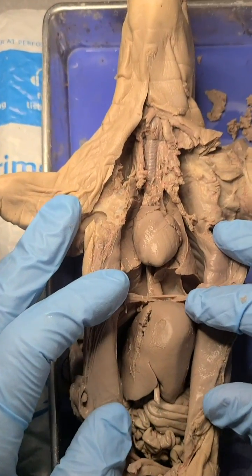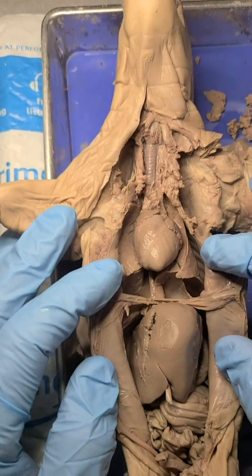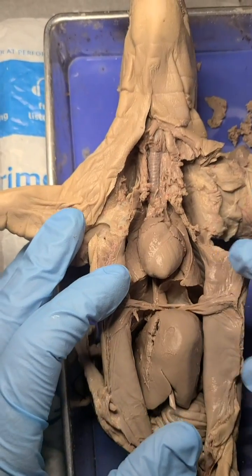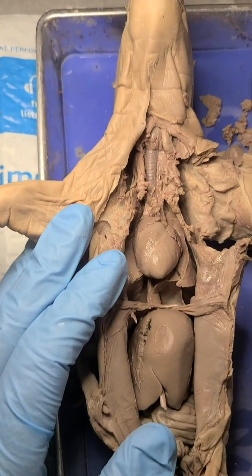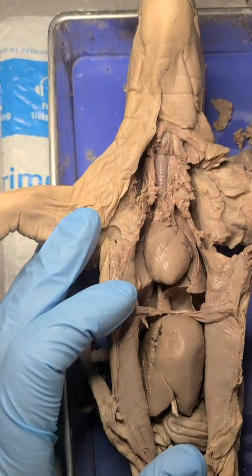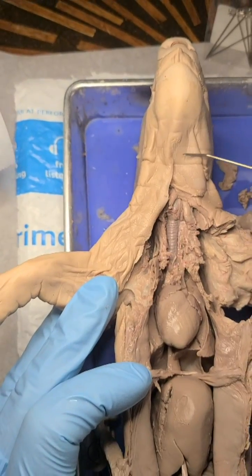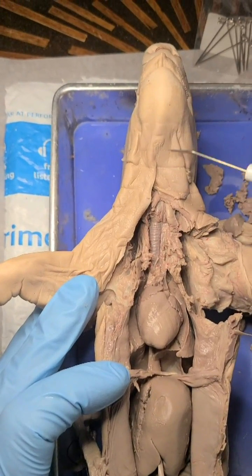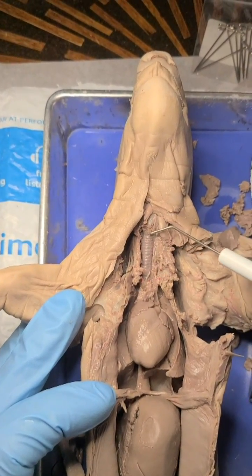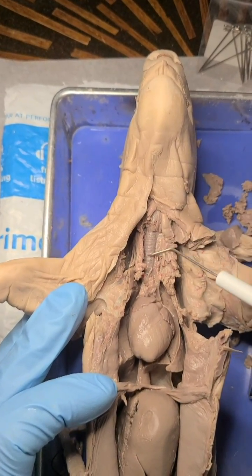I'm going to point out three organ systems in the fetal pig here. First, let's look at the respiratory system. We have the head up here, we have the throat here, and the trachea has been exposed here.